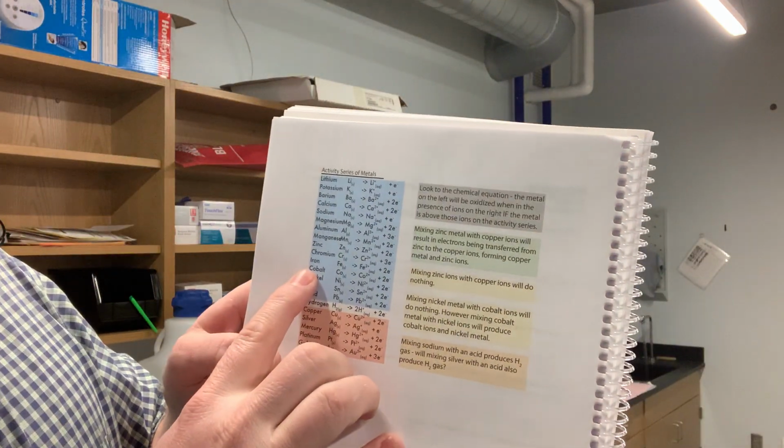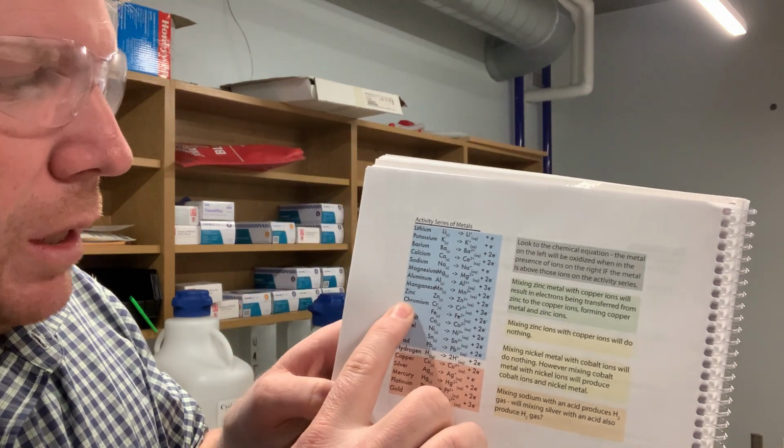under what conditions a reaction takes place. If this metal is put into the zinc chloride solution, no reaction takes place. But then we put it in the nickel sulfate solution and a reaction takes place. Well, that would say it could be cobalt all the way up to chromium. It could be cobalt, iron, or chromium.